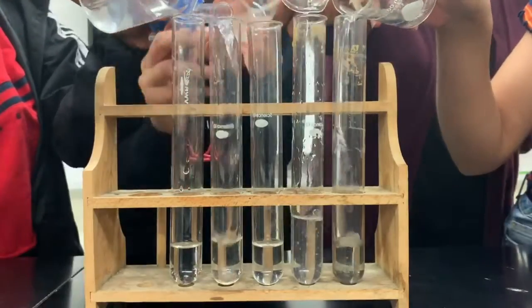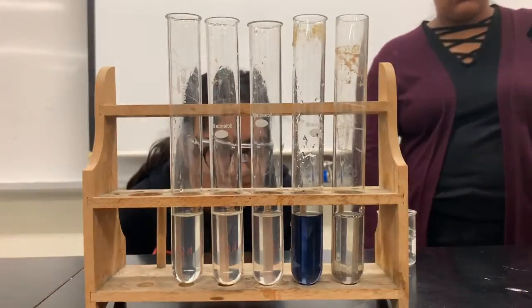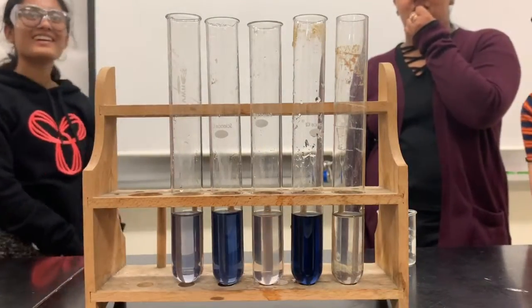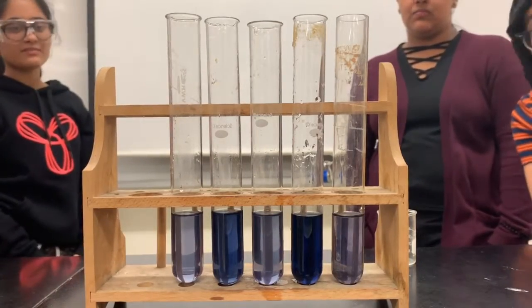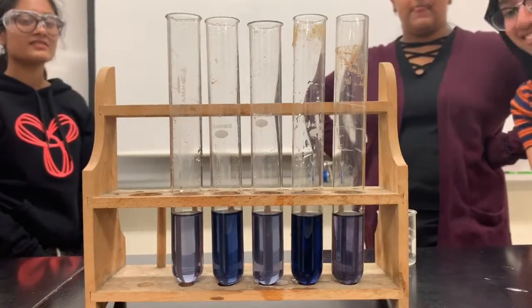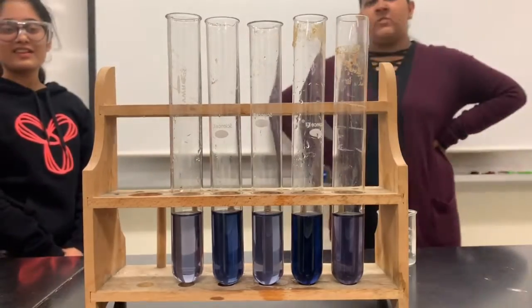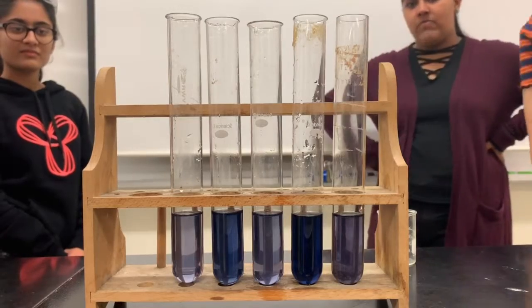Sources of error. One source of error in the experiment was an inconsistency in time for reaction, which resulted in one of our trials displaying inaccurate results. This in turn caused an inaccuracy in the reaction time for certain solutions, as a color change was observed for test tube 2 and 4 before the others, even though they consisted of lower concentration than test tube 1, meaning they should have had a longer reaction time in comparison to 1.